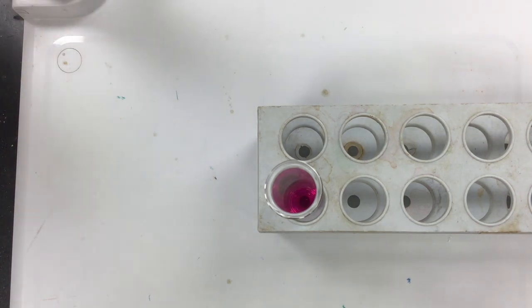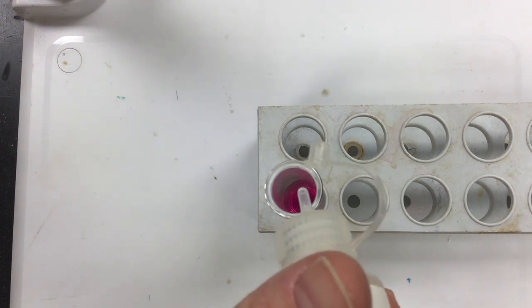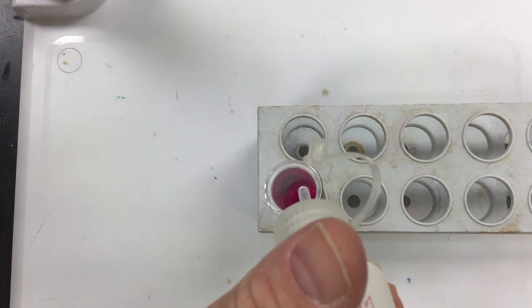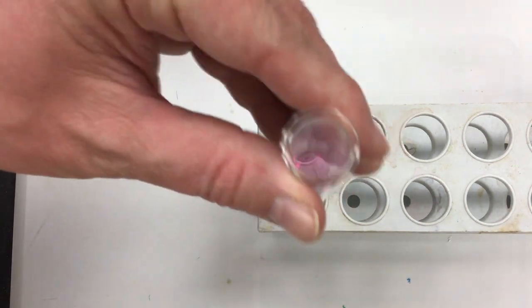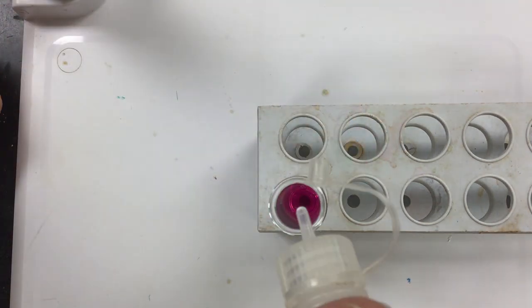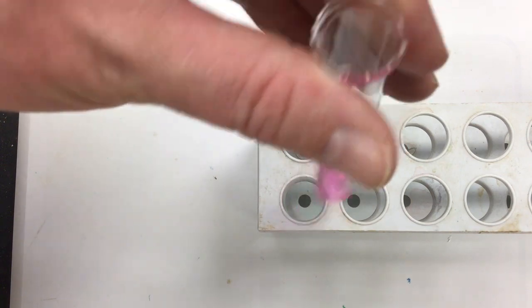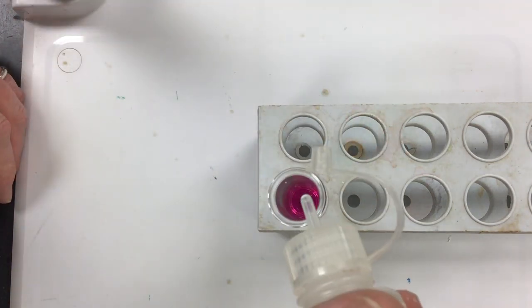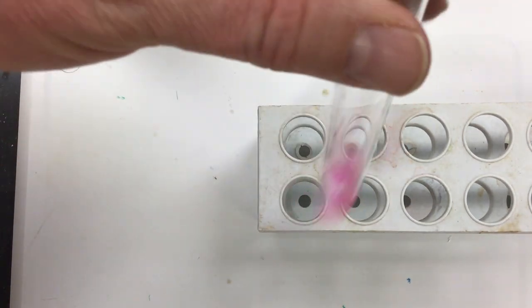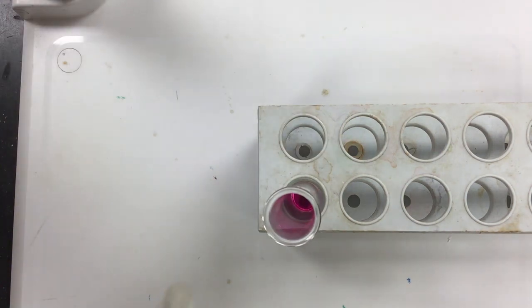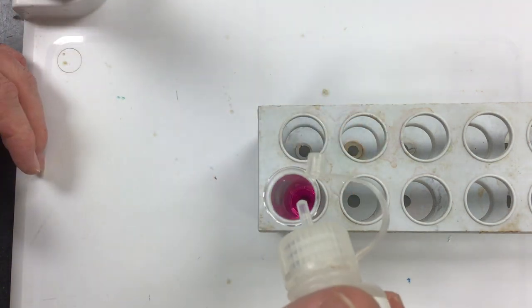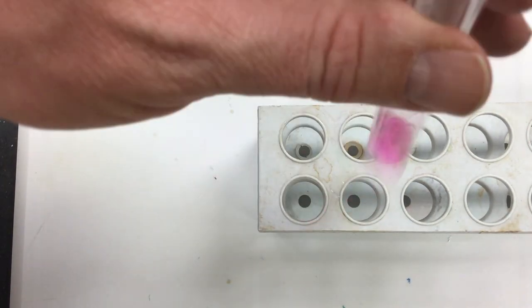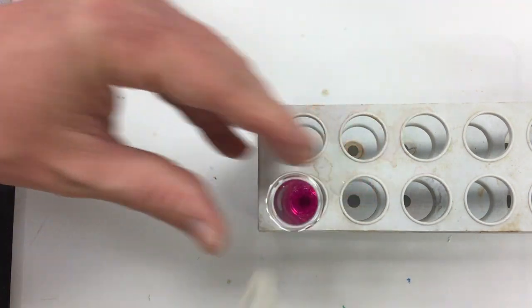God bless it, I don't know how I got clogged all of a sudden. Sorry about that, see if that works. Six, eight, still pink. Nine, still pink. Ten, still pink. Eleven.